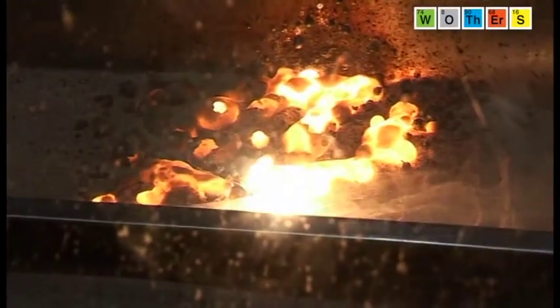If we just keep the lights down for a second — the heat from that reaction has actually caused some of the remaining iron to melt. In here we have molten iron, and this was the heat of the reaction between the iron and the oxygen generating iron oxide.